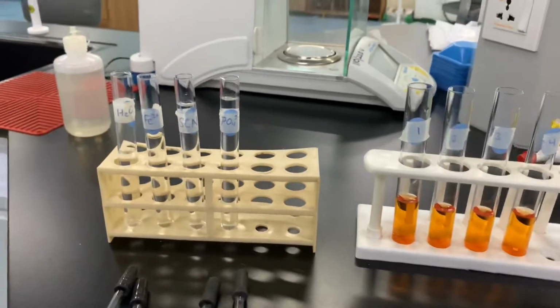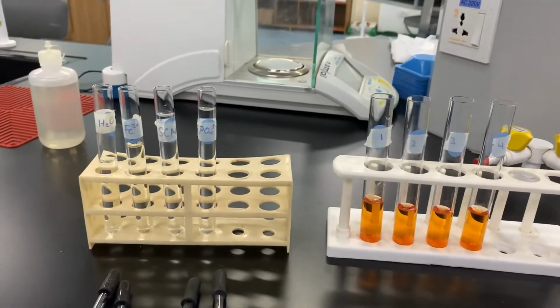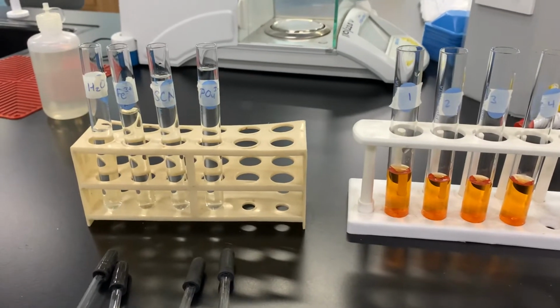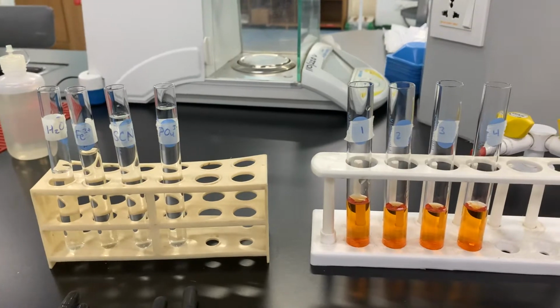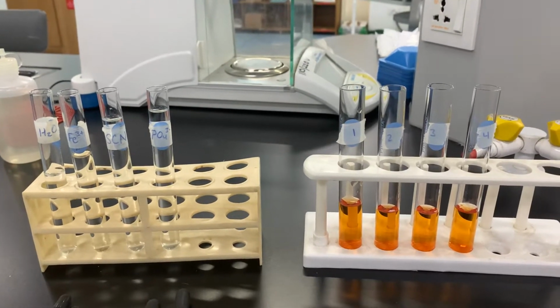Hi there, so we're going to do a short lab today, and I thought I would actually run through doing it with you. I'm going to collect the data, and then you're going to analyze the data.